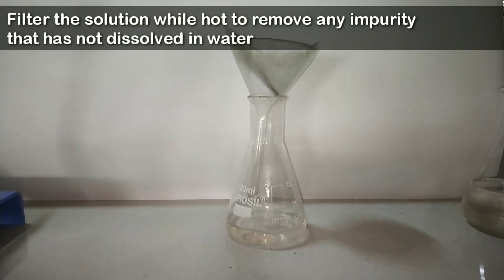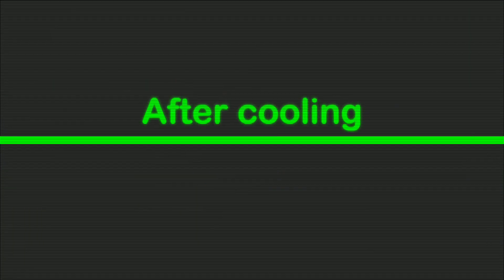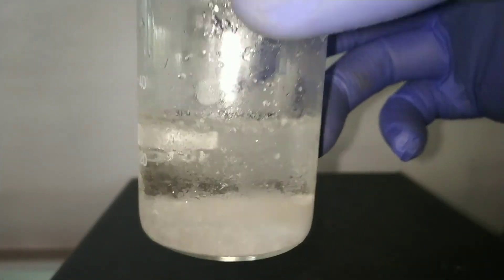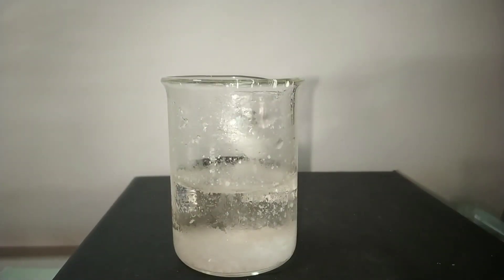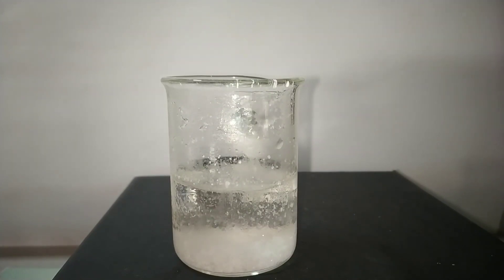I just transferred it into a beaker for better extraction of the crystals. And on cooling, we will be seeing the crystals. Here you can see the recrystallized acetanilide which is much purer than the previous reddish brown. These crystals appear much more white.